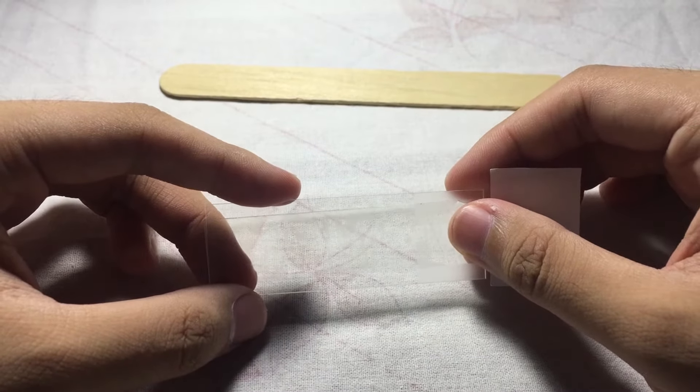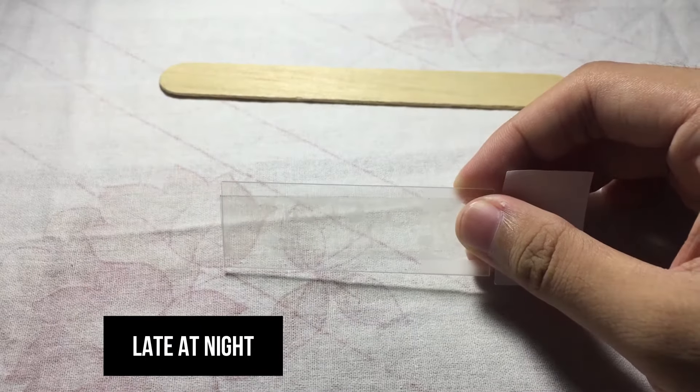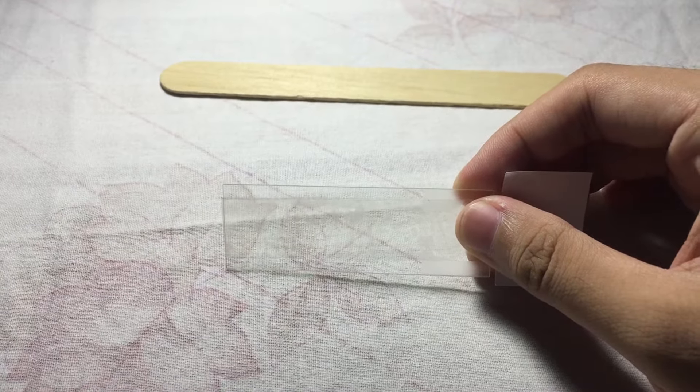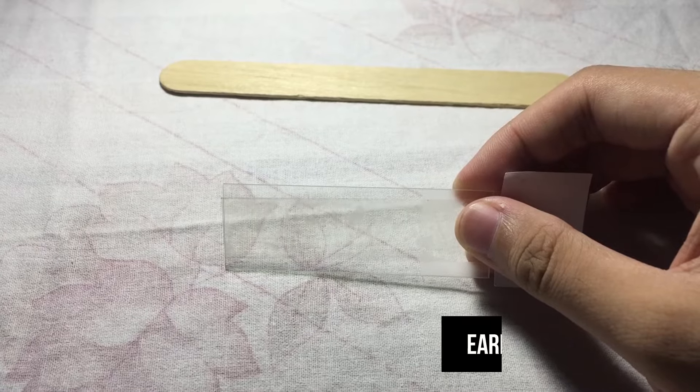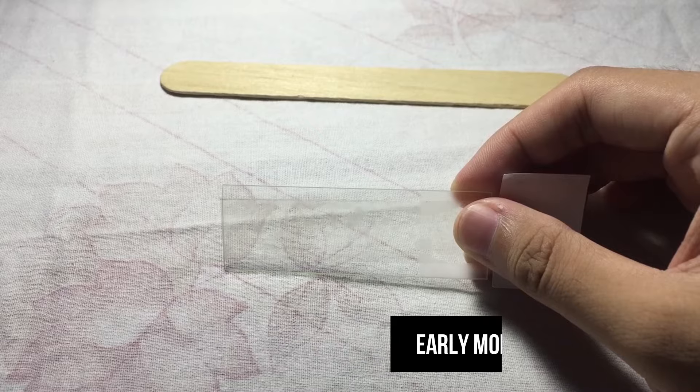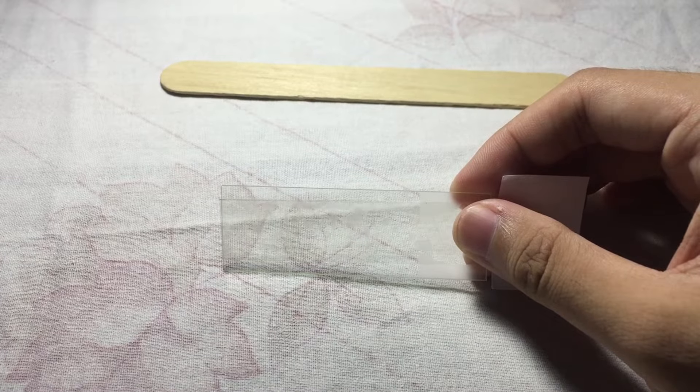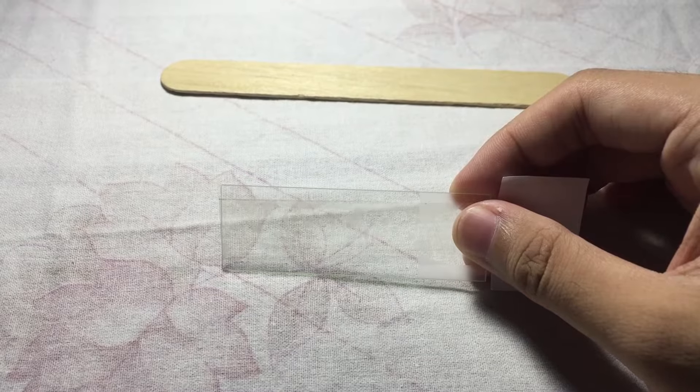The timing should be as long as the patient hasn't taken a bath yet or hasn't washed their perianal region.